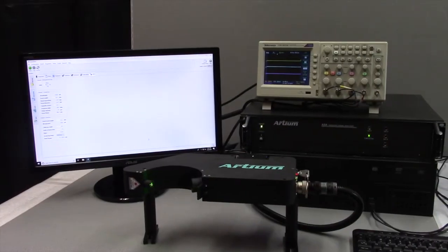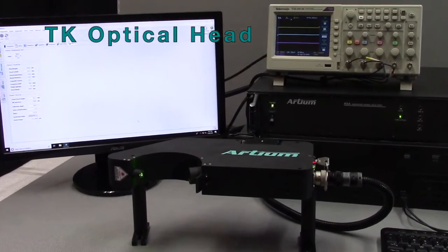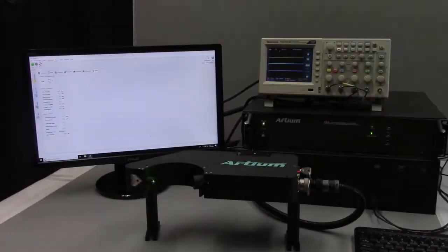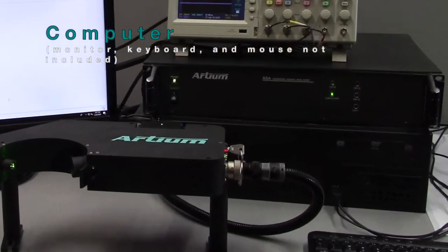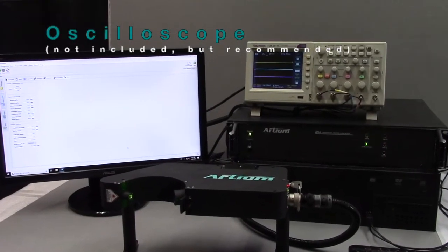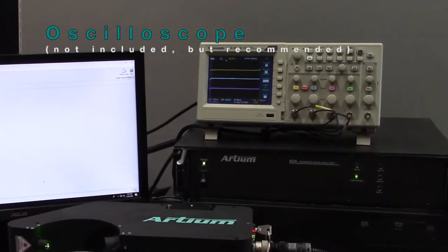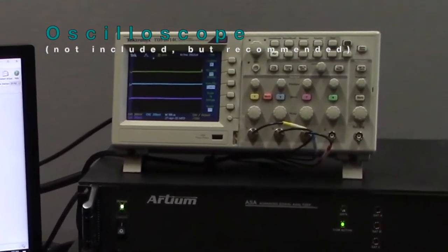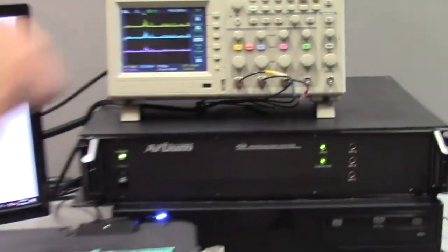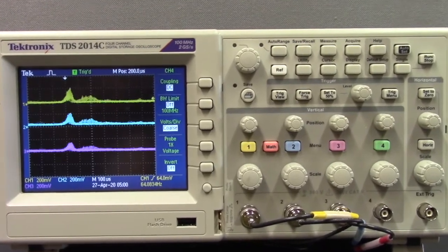So I'm going to introduce you to the components of this system. We have the optical head that contains the laser beam, the transmitter, and the receiver in one package. We have the computer, the monitor, the mouse and keyboard, and we have the signal processor. The oscilloscope is not absolutely necessary, but we recommend that all users have one available at their facility when doing any type of test, because by the quality of the signals on the oscilloscope, you can tell if the system is working properly, the alignment is good, and everything is in place.